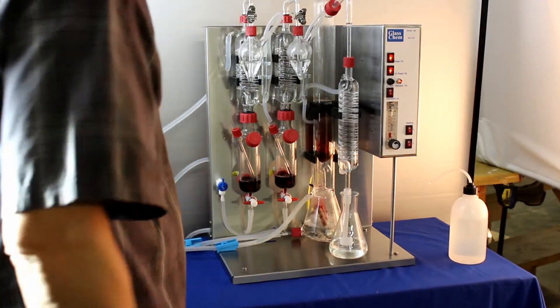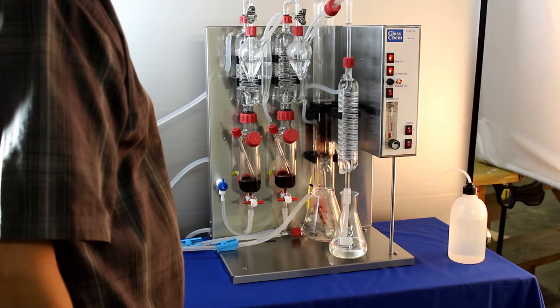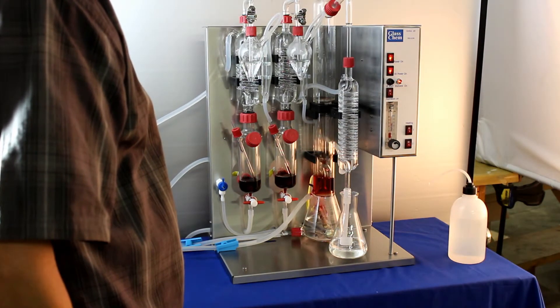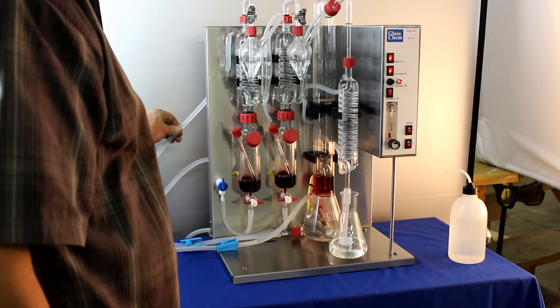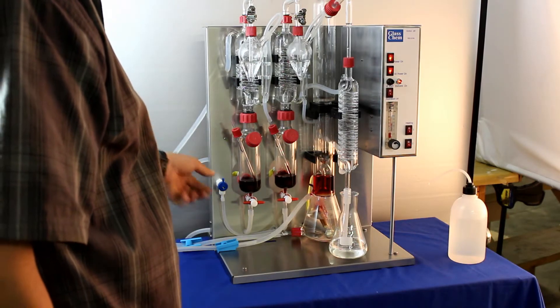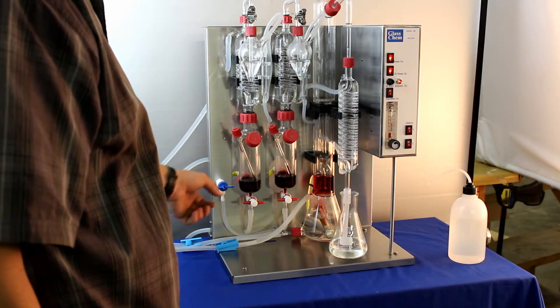When enough distillate is collected open the VA boiler fill valve and pinch the outgoing water pipe. The distillation will stop abruptly and wine sample will suck back into the waste chamber. Fill the boiler with enough water for the next distillation.